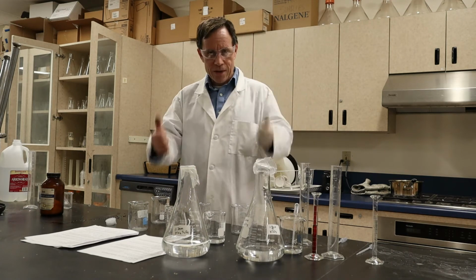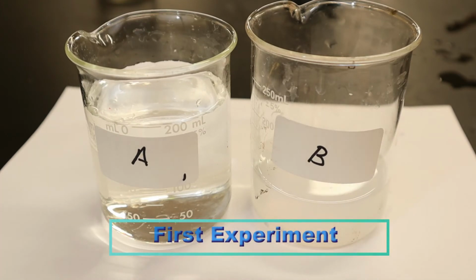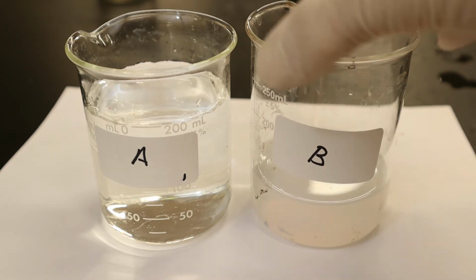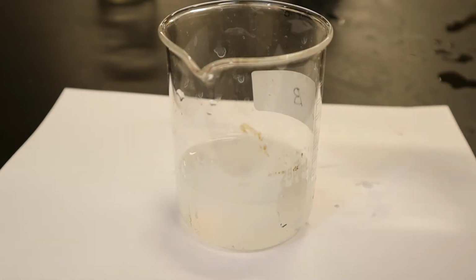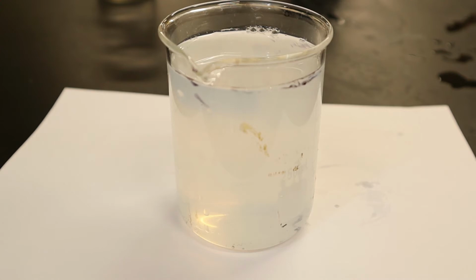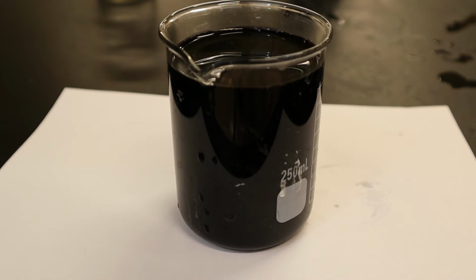All right, I think we're ready to go. Let's do the first solution. You ready? This one has 50 milliliters of the potassium iodate. So we're going to mix the two together. You're going to have to pay close attention, watch carefully, because if you blink, you might miss it. I'm going to turn these around so you can see a little bit better. Here we go. Ready? Start counting. Whoop. There it goes. Isn't that great? That's fantastic.